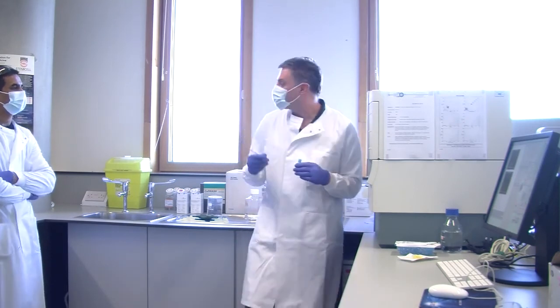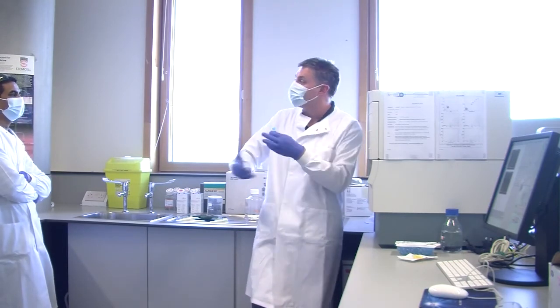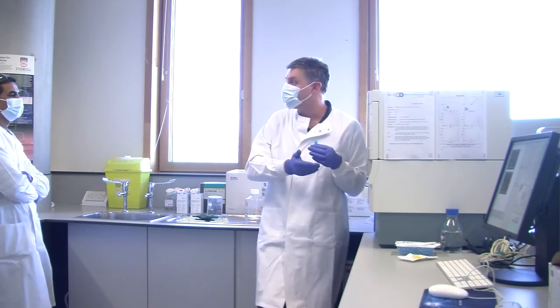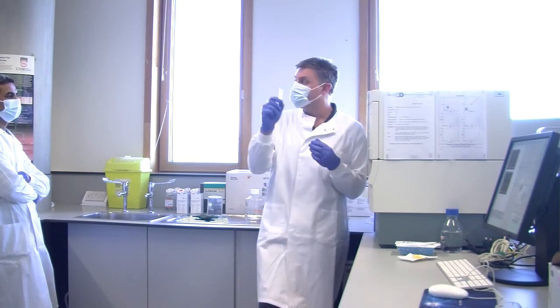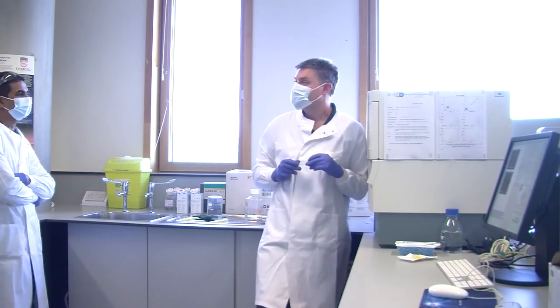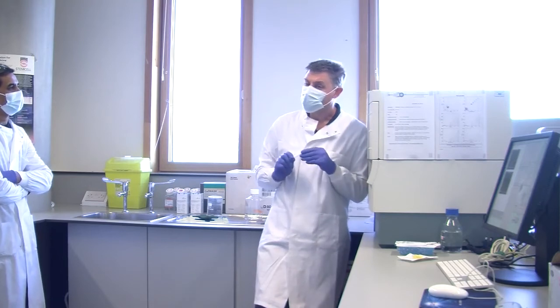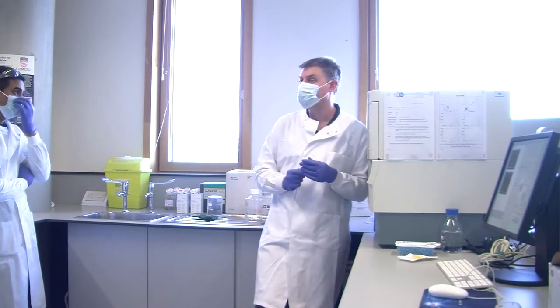Say we're doing an experiment where we're trying to induce pluripotent stem cells. We've got our cells growing in cell culture, we add treatments, we're adding experimental drugs, and so on. We harvest them off, often with trypsin, which is an enzyme that chops through the extracellular matrix. We spin them down, label them, put them through a cell strainer, run them on here, and we find we've got very few pluripotent stem cells. You go, oh, the drug hasn't worked. We spent millions developing this drug, and it hasn't worked. Oh no. But what if your drug, in addition to making them pluripotent stem cells, also makes them really sticky?